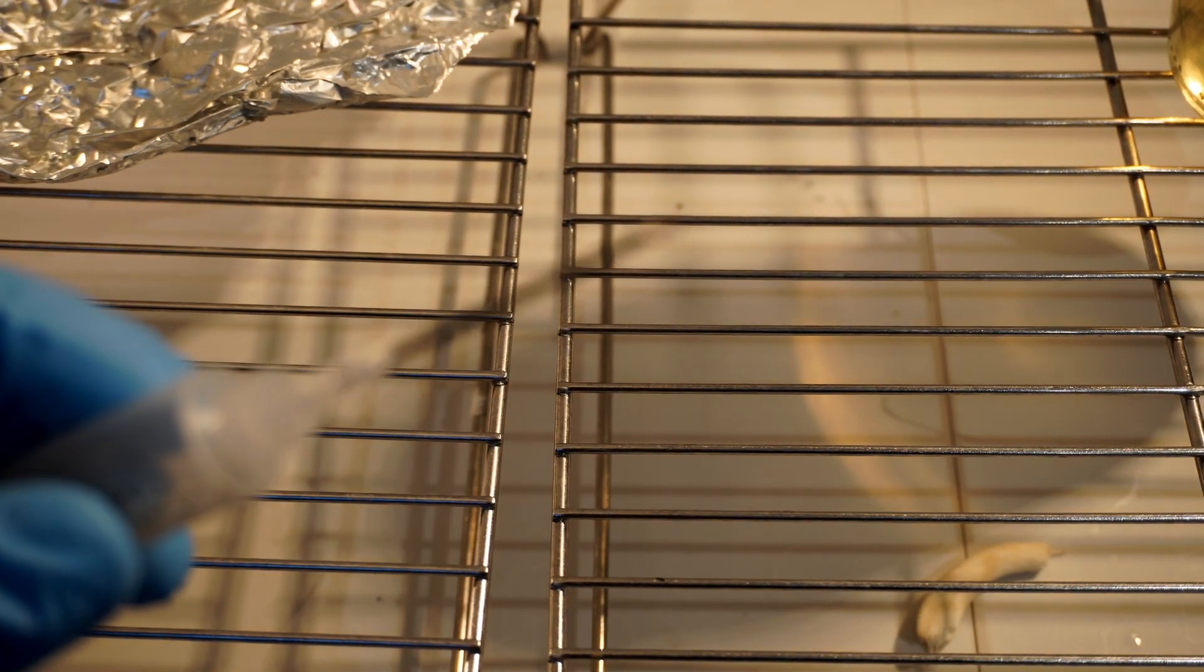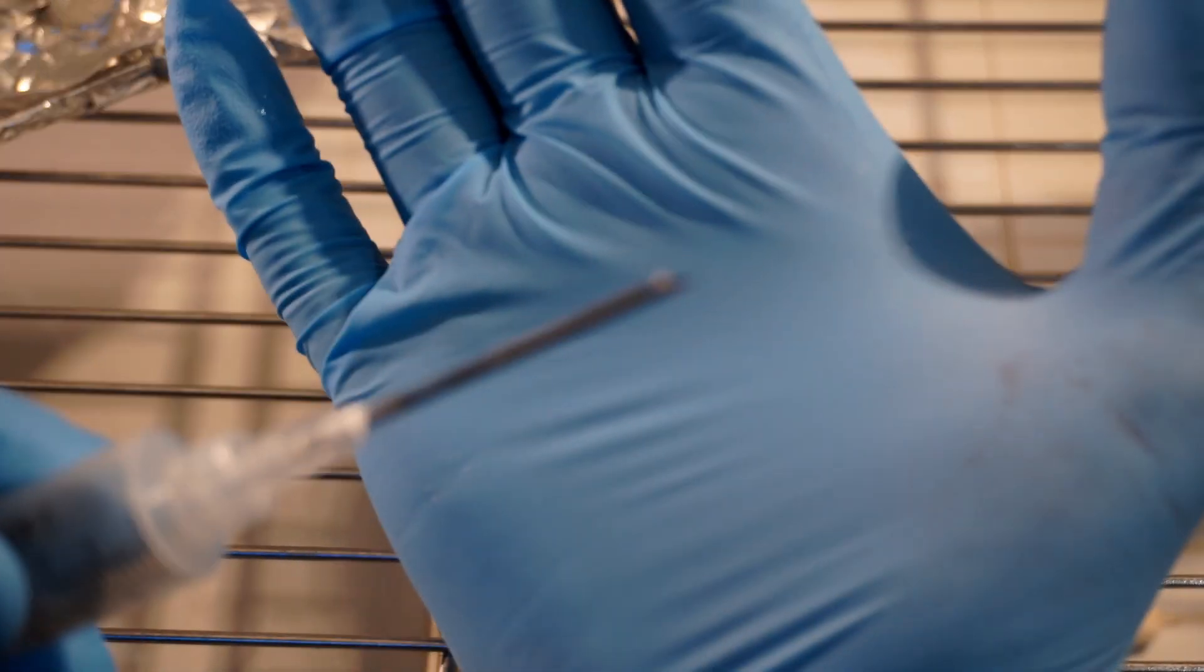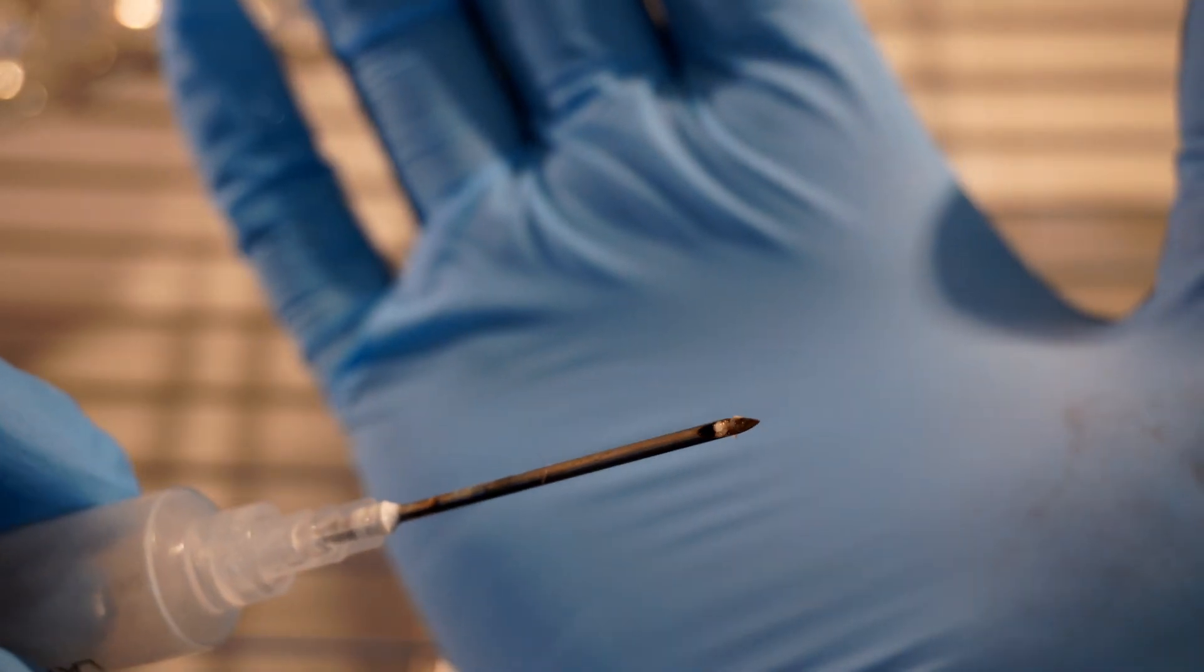Once you've got a piece of tissue on the end of your needle like I do here don't sit around and look at it like I am. You want to go and inject it straight through the injection port.